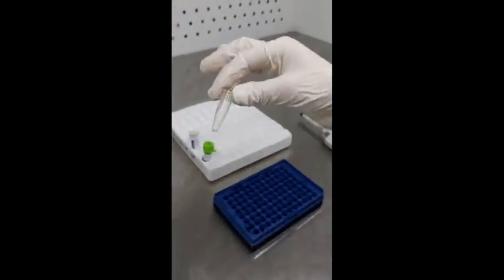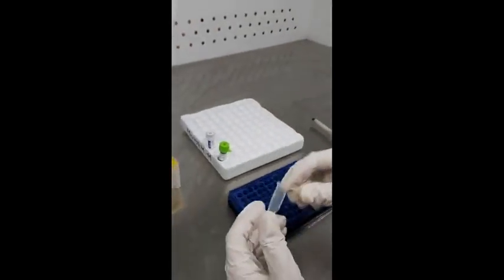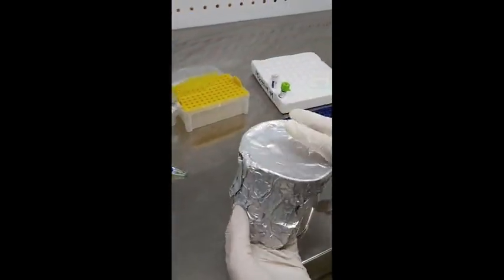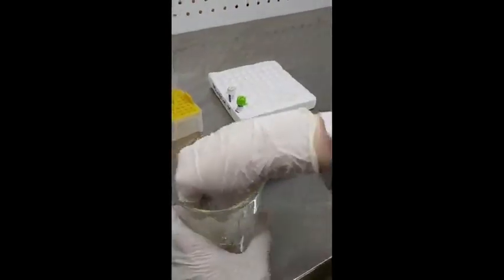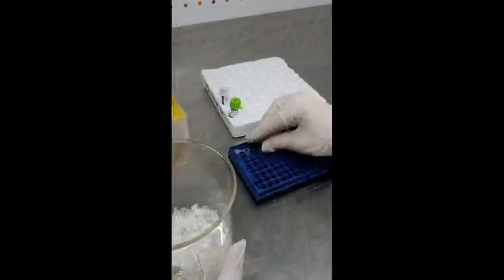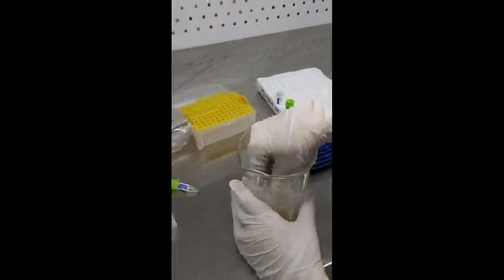What you have to do is take a large tube for making a large amount of the solution, which will be further transferred to the small PCR tubes. These are the PCR tubes — the ones actually used in the PCR. You keep them in the PCR tray; the blue one over here is the PCR tray in which we keep the PCR tubes for running the PCR.